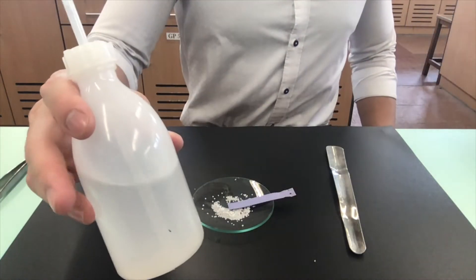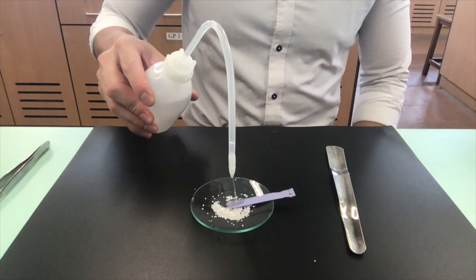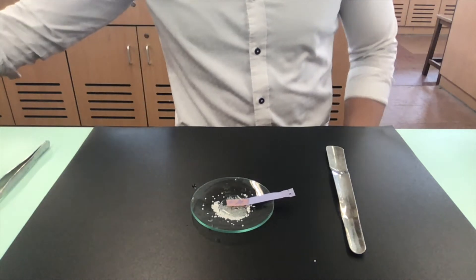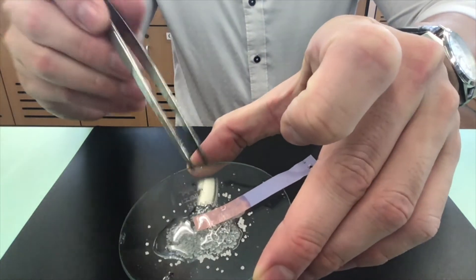We will now add distilled water to the acid. The blue litmus paper turns red in the presence of water. It shows that water is necessary to show the acidic property of citric acid.